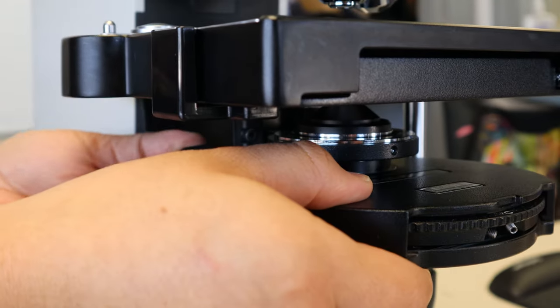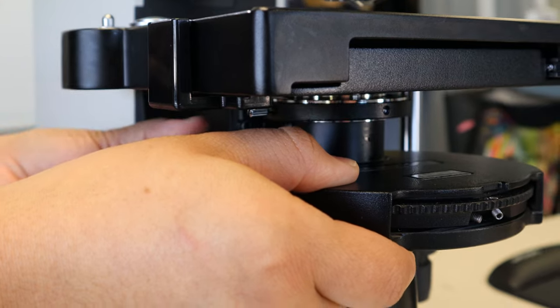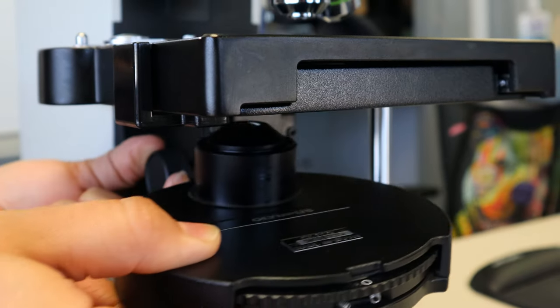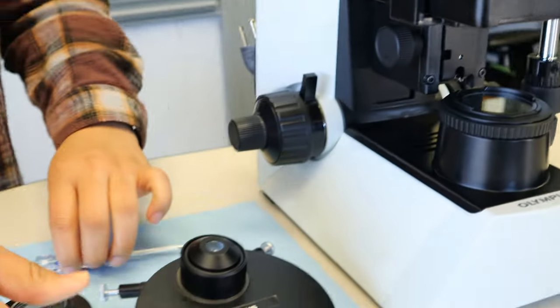So then she is just going to hold the condenser in place, raise the assembly, and she'll be able to slide it right out of the way. Then you just set it down and you're all done.